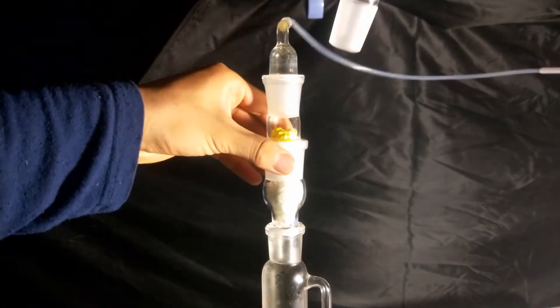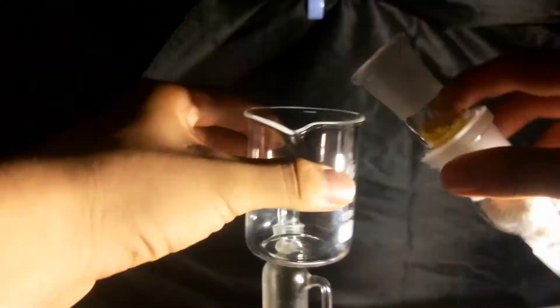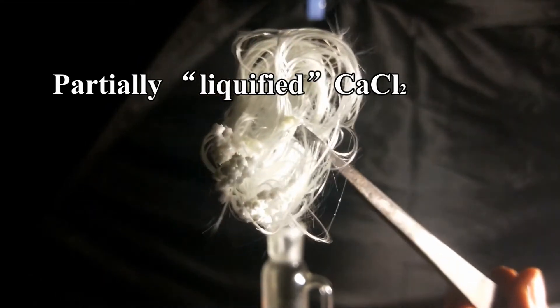Let's have a look at our drying agent. Some calcium chloride on the top looked yellowish. That was the color of iodine trichloride. Then we found out some calcium chloride partially liquefied, which was the evidence of water being absorbed.